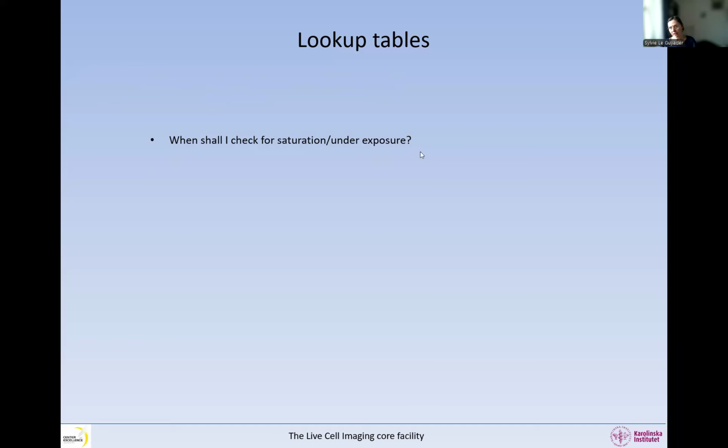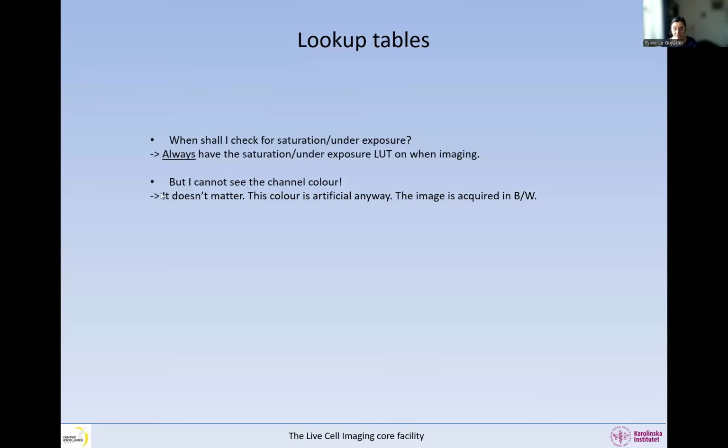So when shall I check for underexposure and saturation? Well, just leave the mask on all the time. Always have this mask on, because this is an artifact. And again, your images are likely to be rejected, and the worst thing that can happen is that your data is wrong. So leave this on, okay? Oh, but I cannot see the channel color. Yeah, it doesn't matter. This color is anyway artificial.